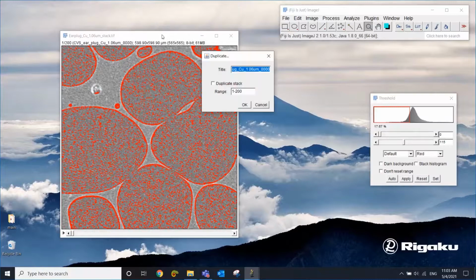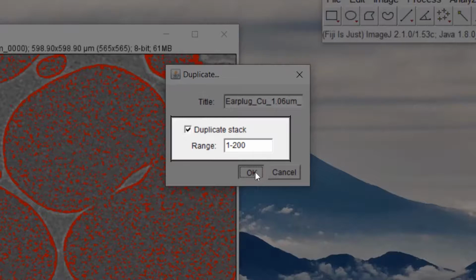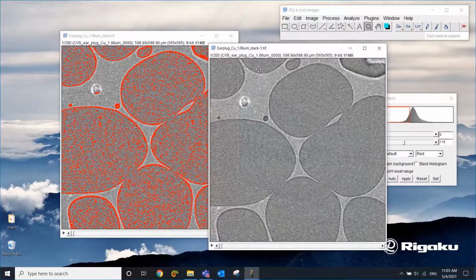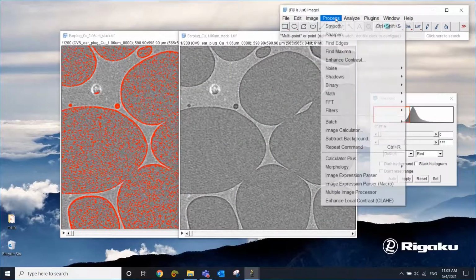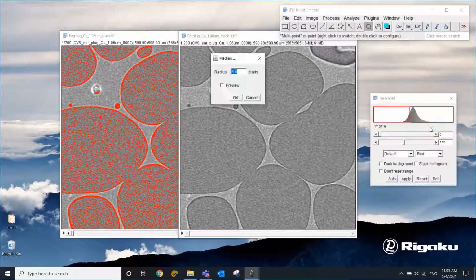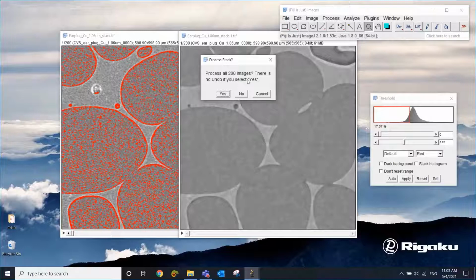So I'm going to duplicate this image and check this. When you're dealing with the CT scans, always remember to apply whatever you're doing to the entire stack, not just one slice you're looking at. So I duplicated the entire stack like this, okay? Now we're gonna apply a filter. We know that the median filter works relatively well, so let's do this. Okay, this looks not too bad, so I'm gonna just go ahead and apply it. Again, yes, I want to apply this to the entire stack.